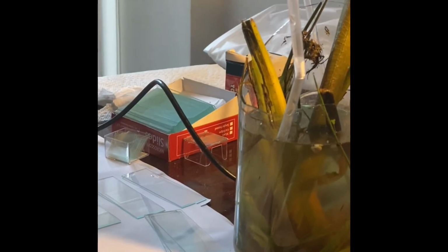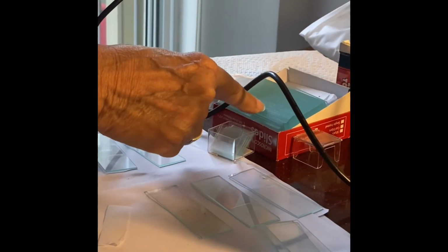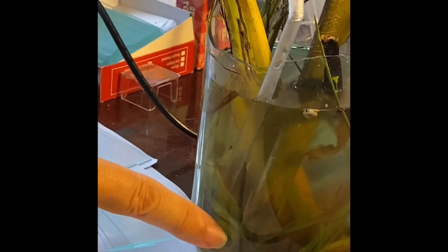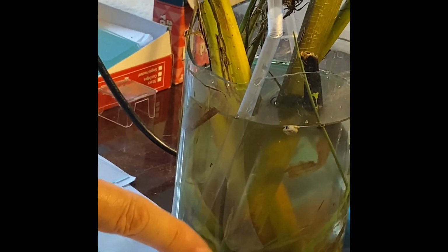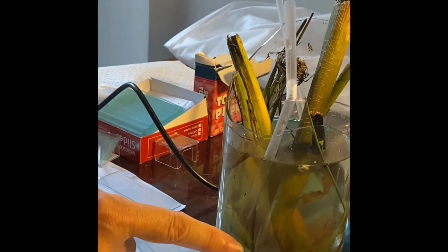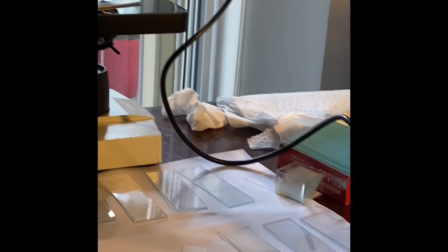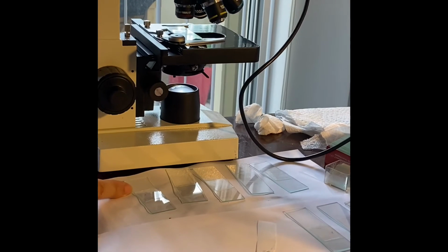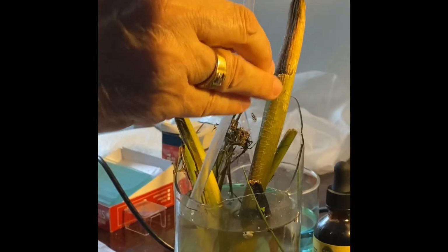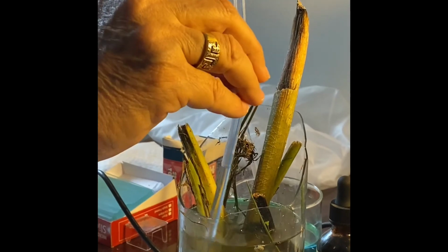The materials needed would be cover slips, slides, clean ones as usual, your container of pond water, it may look like this, or stream or lake water, a slide, a cover slip. I use my straw as a dropper. This is my dropper. It's long.